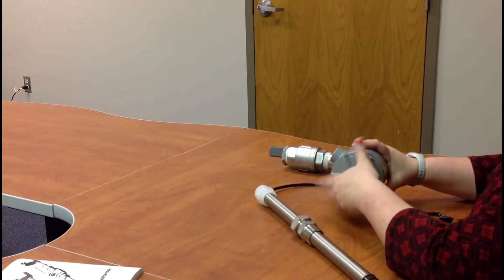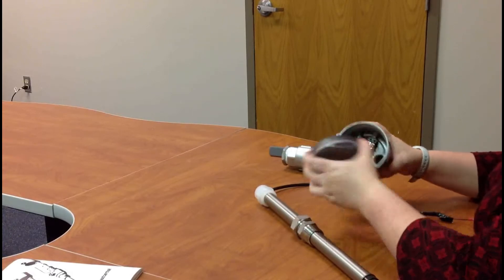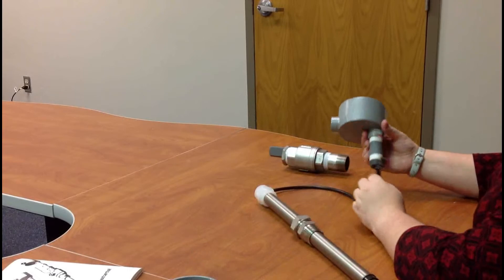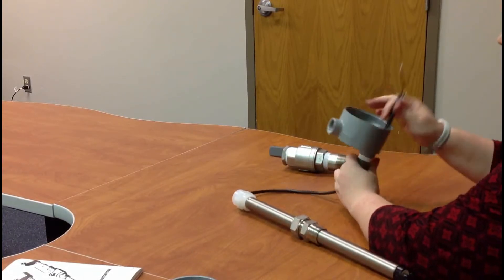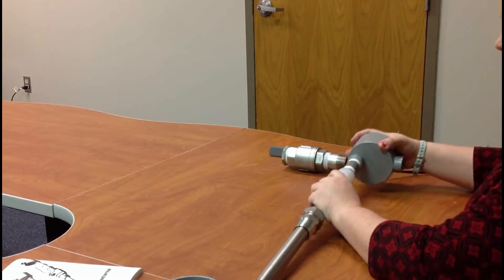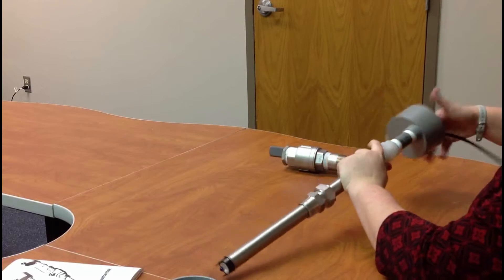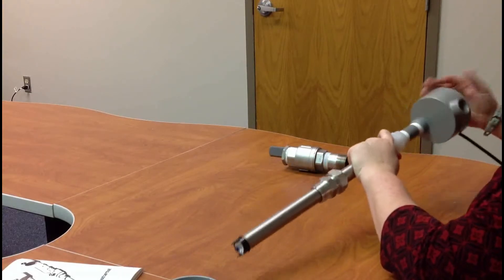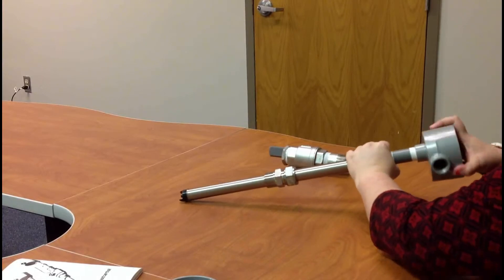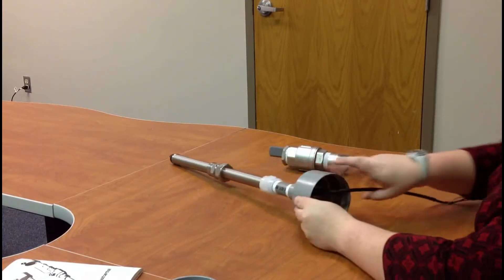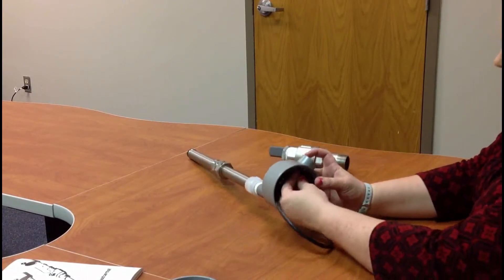Now, uncap the J-Box. Alrighty, and you want to note here, when you're going to thread through straight up into the J-Box head your cables, there are two different types of sensors that you can get. One where you're going to actually use the J-Box, the threads inside the J-Box, and the other one where you're going to bypass the J-Box completely and wire it through the J-Box head.